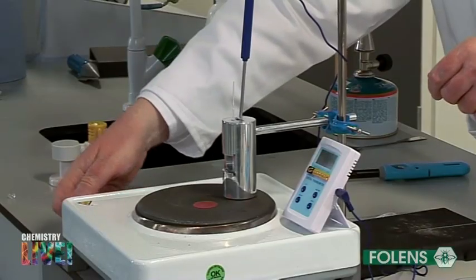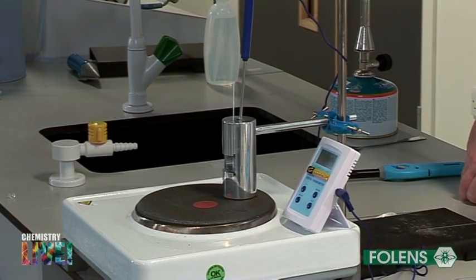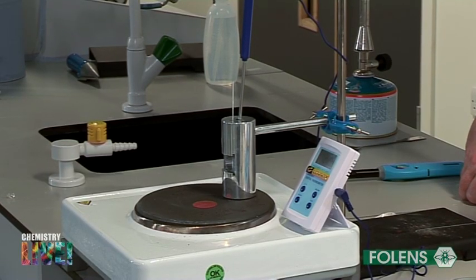Turn on the hot plate and observe the crystals until they melt, that is, until they turn to a colourless liquid.